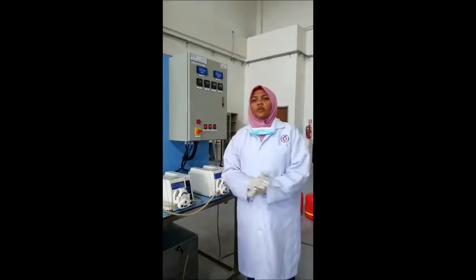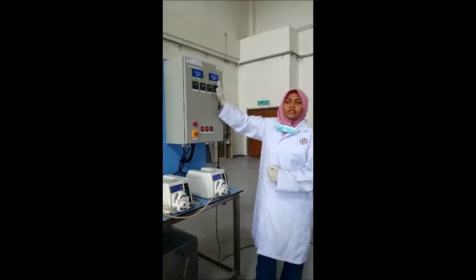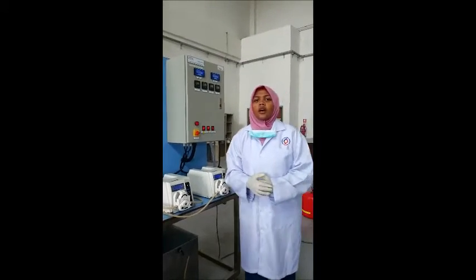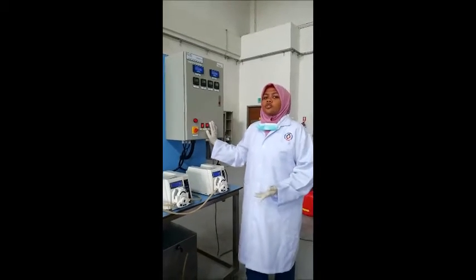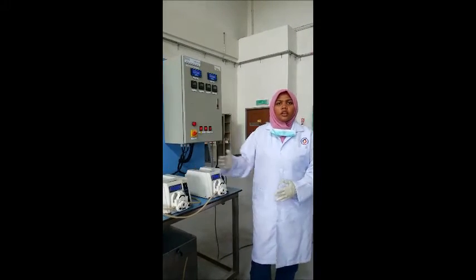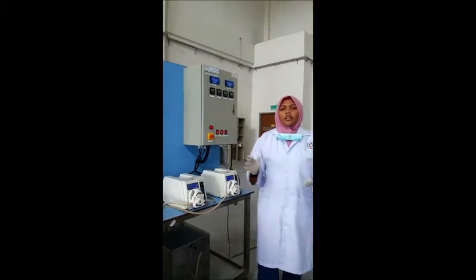For example, we wait for 1 hour and monitor the reading of conductivity. If it goes low and reaches the lowest value and the number isn't changing anymore, then we take that as the lowest conductivity that this machine can detect. After the circulating process, or the flush process, we can drain all of the water inside the tank, and we can now begin the experiment.